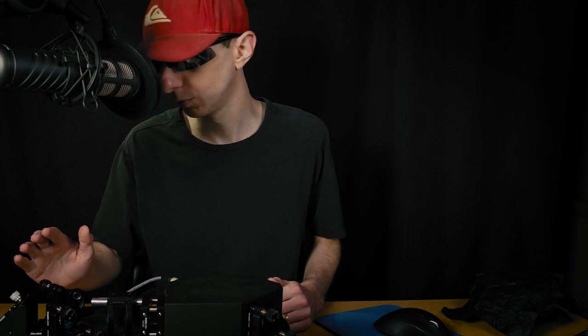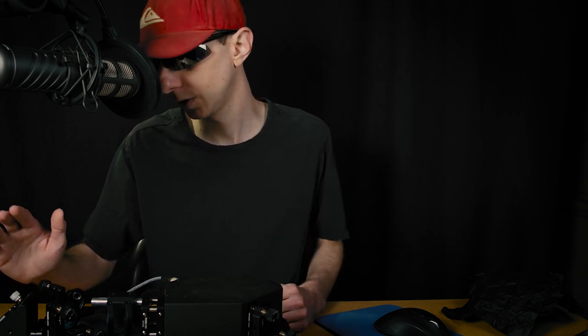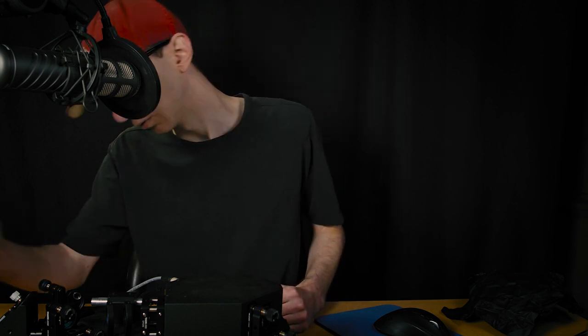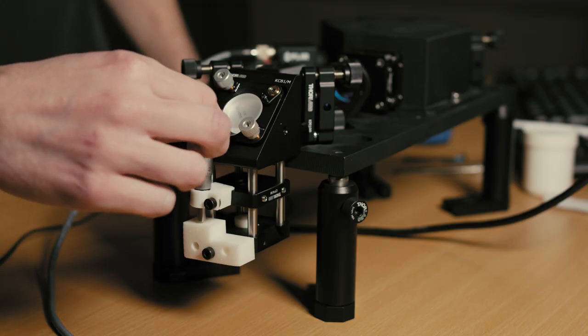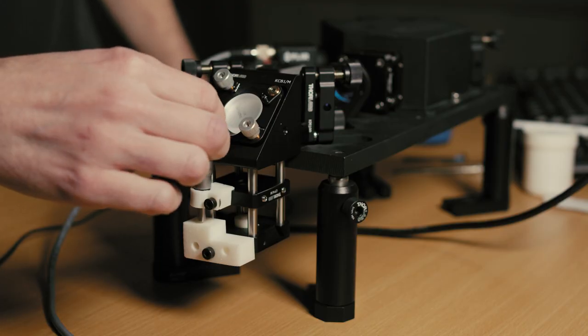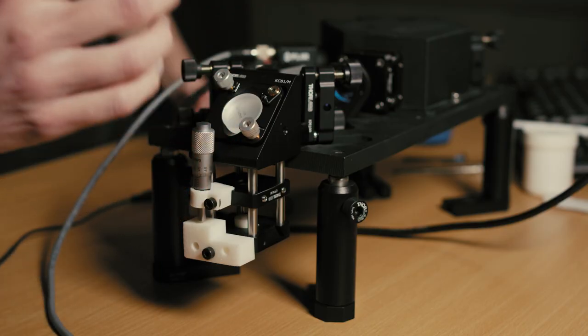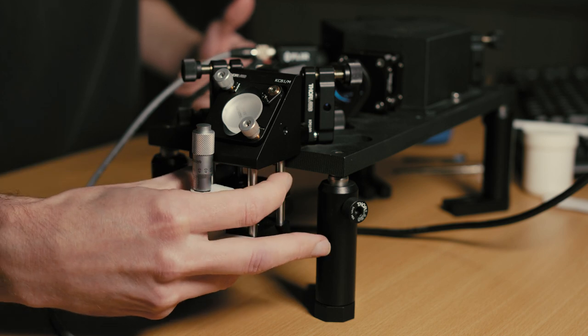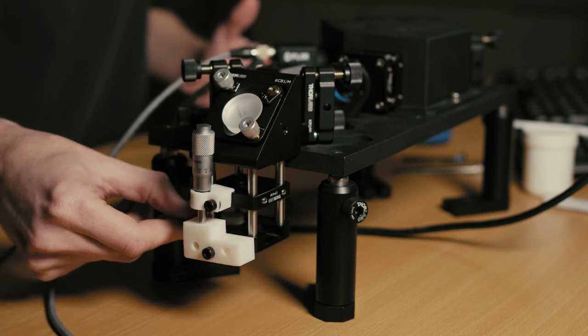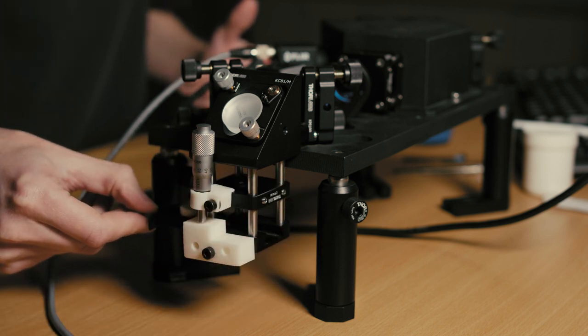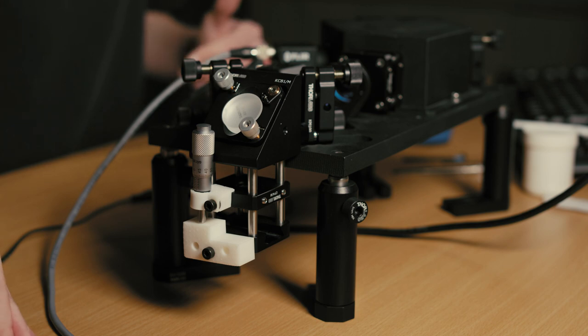It's relatively straightforward to assemble and you can check the drawing here. So the first thing I will do is I will put this at the nominal position which is 6.5 millimeters and I will remove the tray.